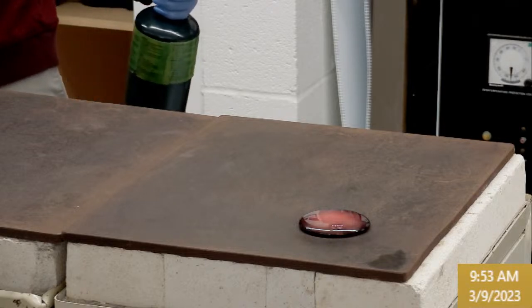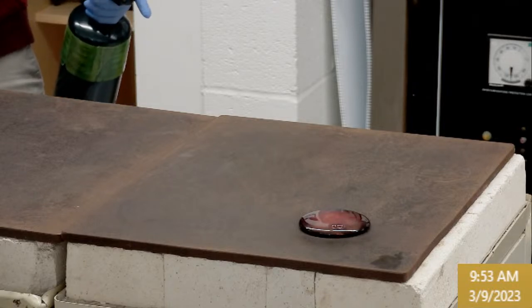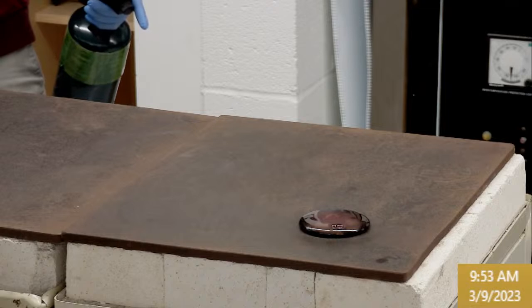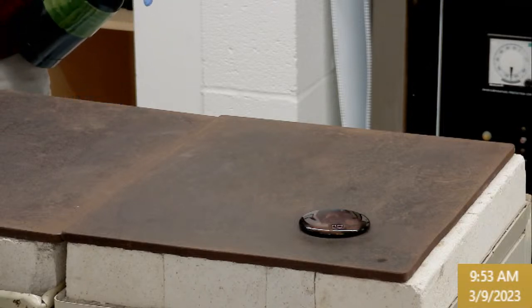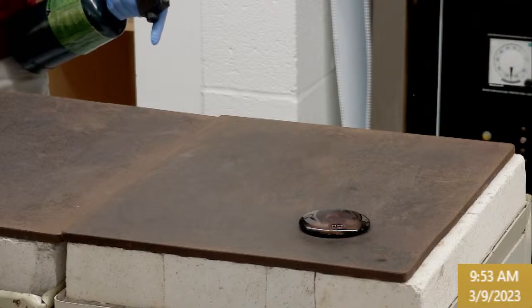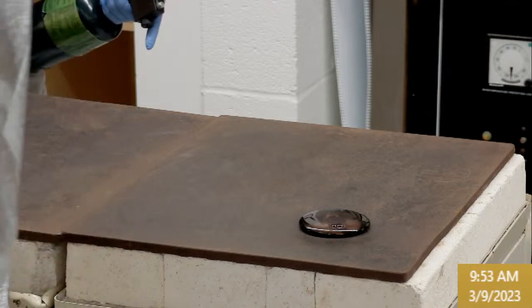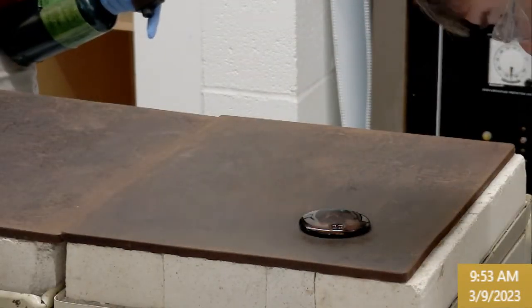This little bit here cools first. And resist any urge to touch fiberglass. It has a way of breaking unexpectedly and stabbing you. I've had that happen to myself before. So there's going to be little spines of glass up here. They're like, you know, porcupine quills. They bend a little bit, but then you're like, wow, this is really flexible. And then right when you say that, it snaps and sticks you like a hypodermic needle on the finger. So I'll be breaking all those off and making the crucible safe for inspection a little after we start.